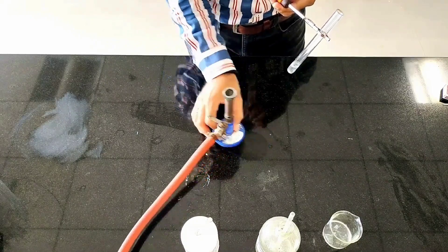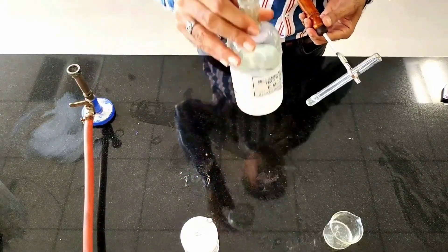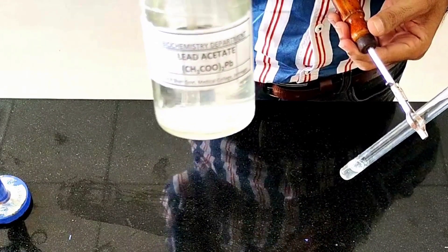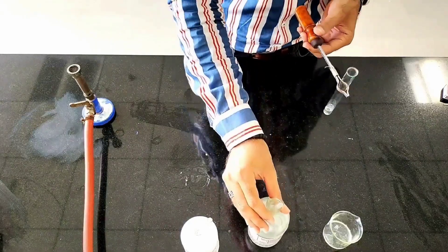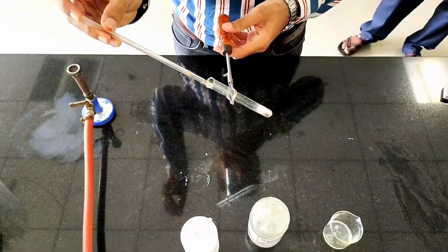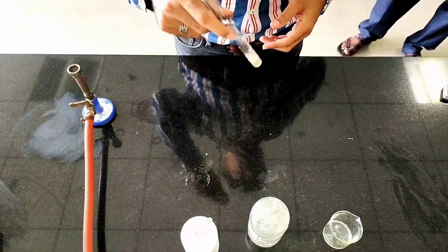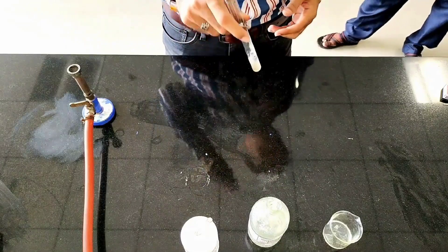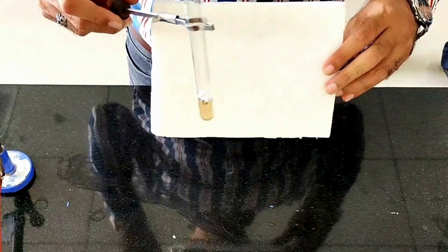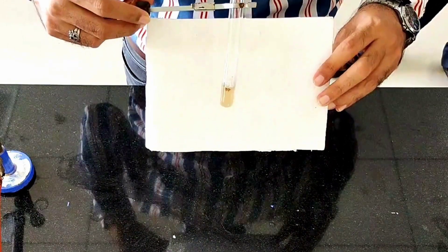Then we will add a few drops of lead acetate. Development of a black or brown colored precipitate indicates the presence of sulfur-containing amino acids.